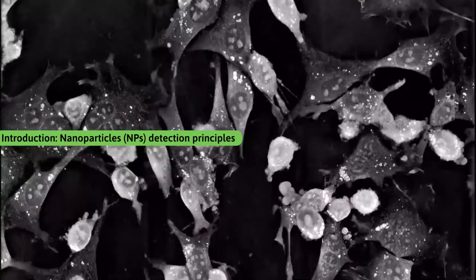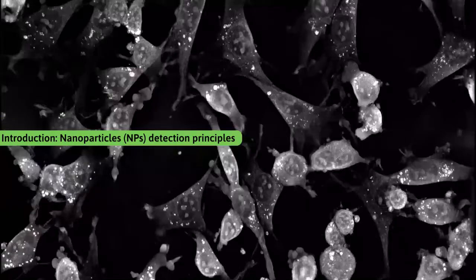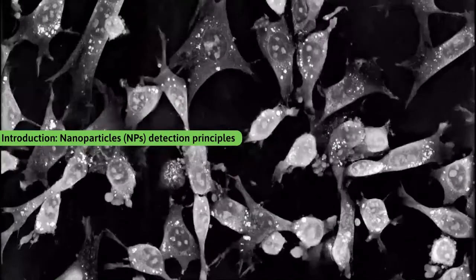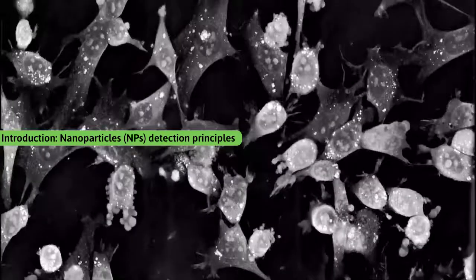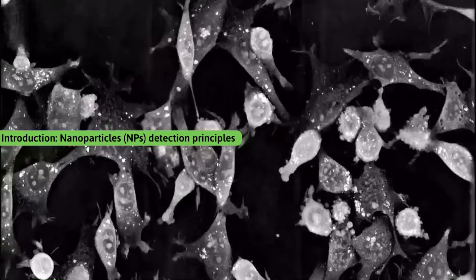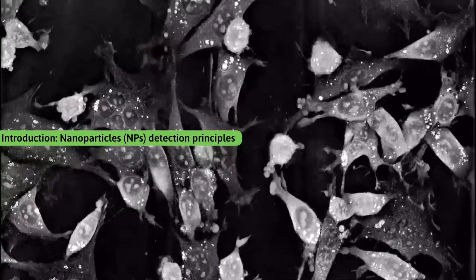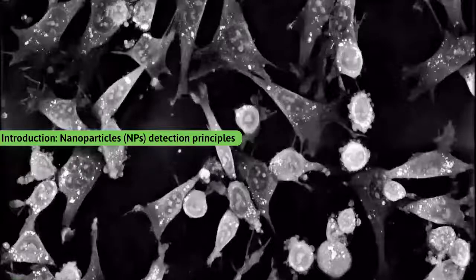In this case, 6 different fields of view are combined together with multiple tiles in a mosaic acquisition. You have a good overview of cell interaction, proliferation, and also internal compartments such as nuclei and mitochondria.